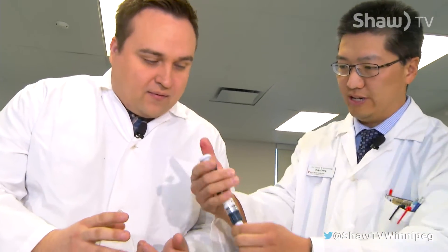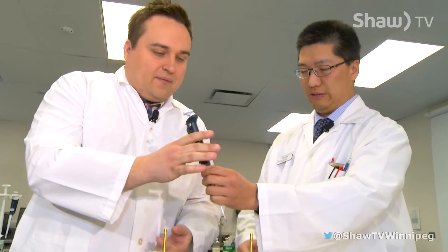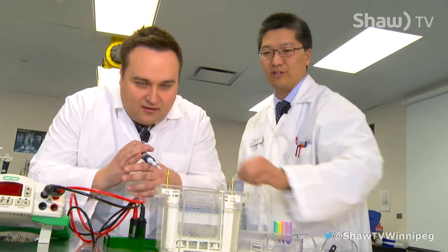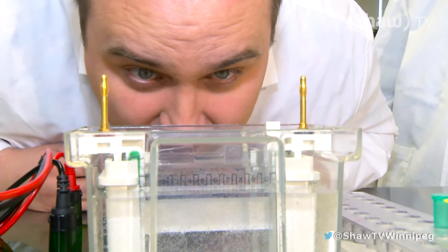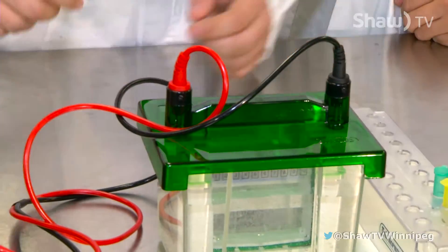We took a sample, and you want to hold it in such a way that your finger rests right at the grip — like this. That's right. Now press the plunger. There you go. Lift it out and you've just loaded your first sample. Once we have loaded the sample, we would apply an electrical charge to it.